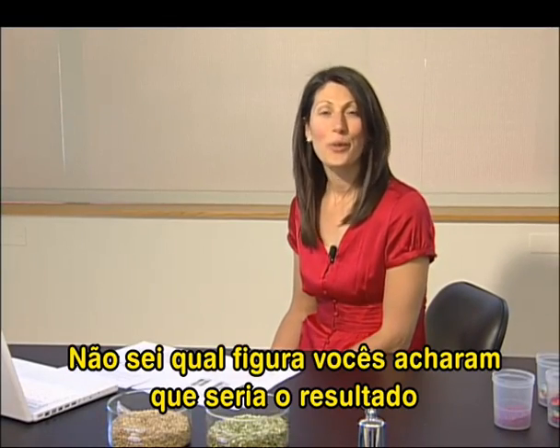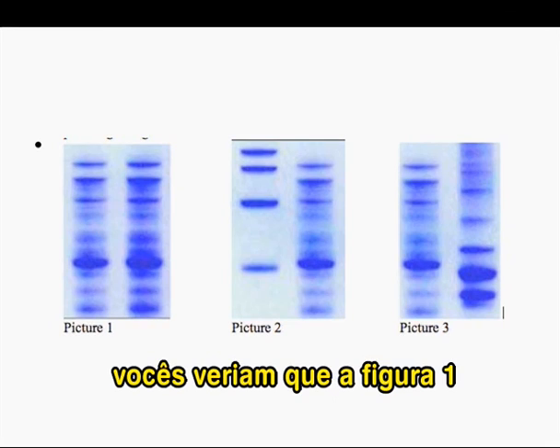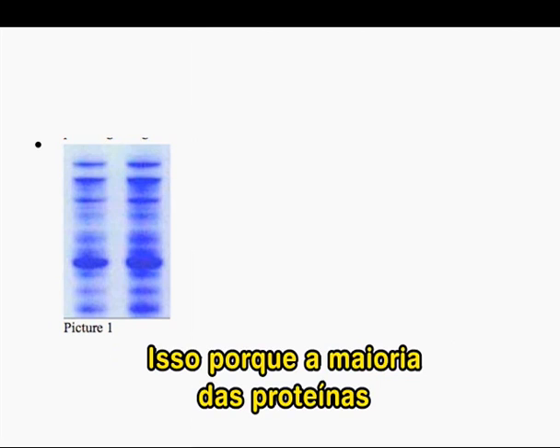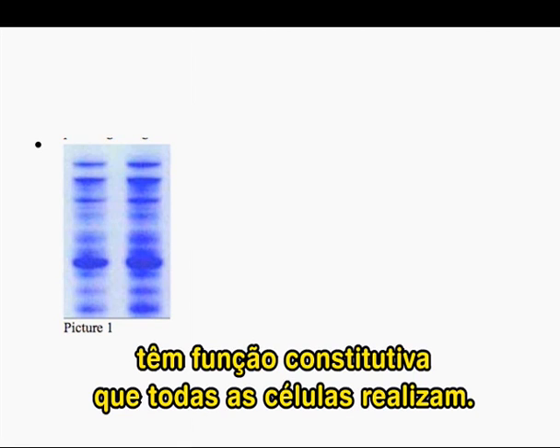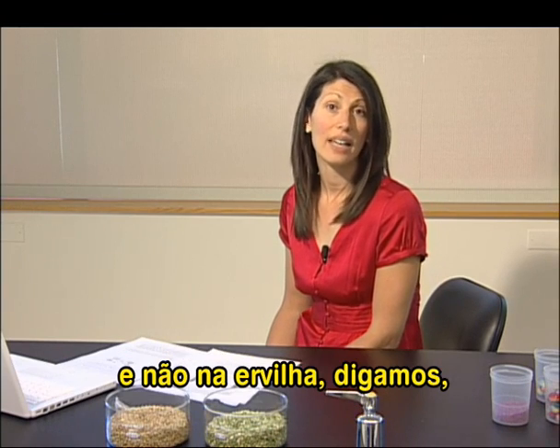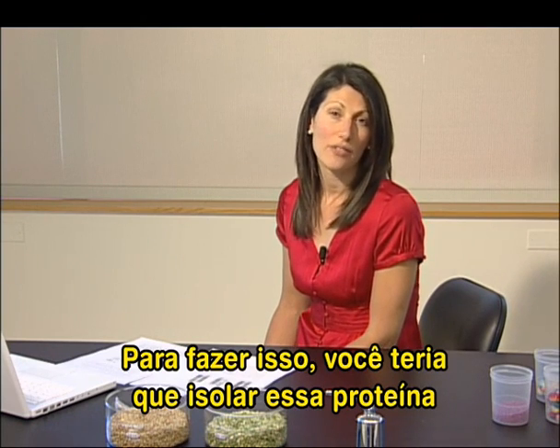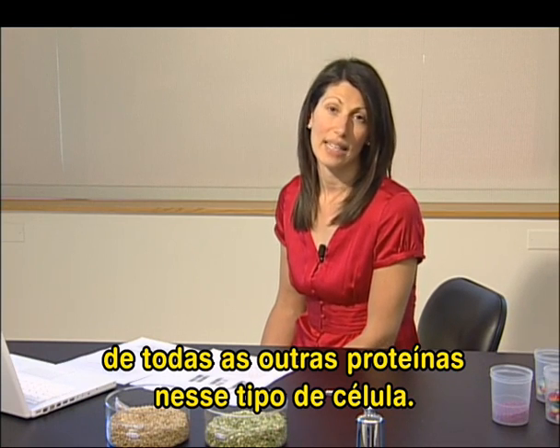Hello again. If you were here in my lab and ran this experiment, you would see that picture one is closest to the result you would find for the two protein profiles. That's because most of the proteins in lentils and green peas are the same — most proteins in the cell have housekeeping functions that all cells have to carry out. So what if you wanted to study something specialized to say lentils and not in the green peas, and find a protein just from lentils? Well, to do that, you would have to tweeze apart that specialized protein from all the general housekeeping proteins in that cell type.